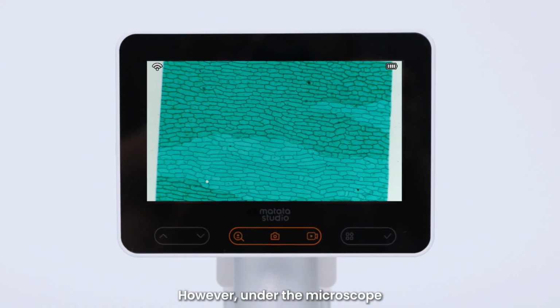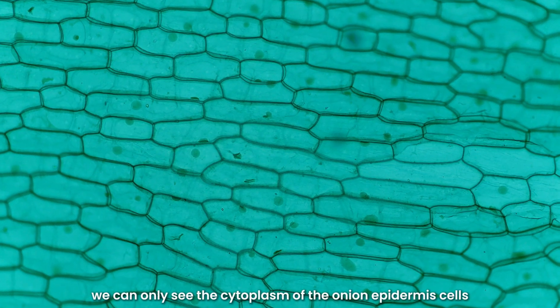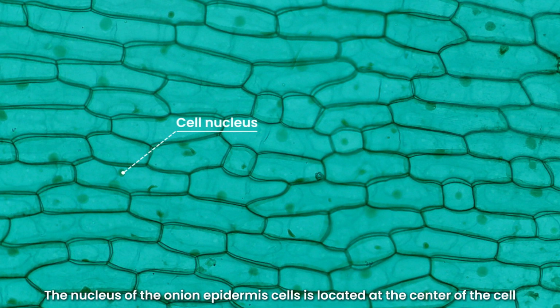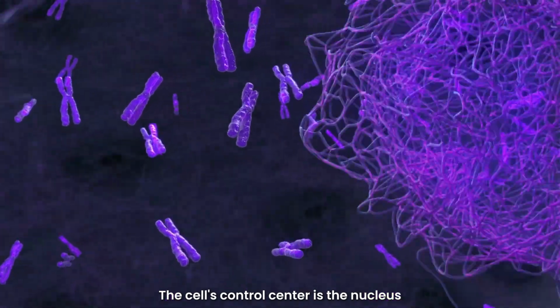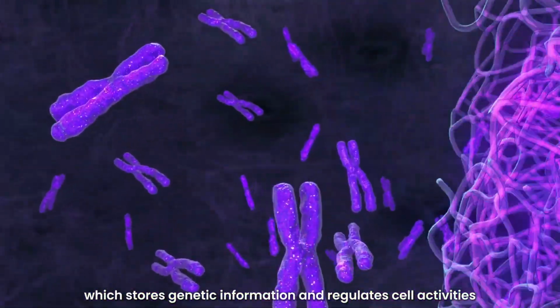vacuoles. However, under the microscope, we can only see the cytoplasm of the onion epidermis cells, not the individual organelles. The nucleus of the onion epidermis cells is located at the center of the cell and usually appears as a spherical structure. The cell's control center is the nucleus, which stores genetic information and regulates cell activities.